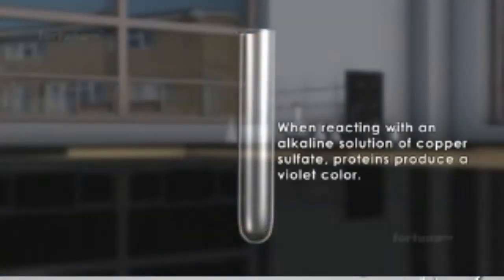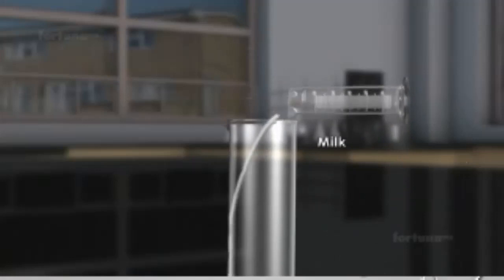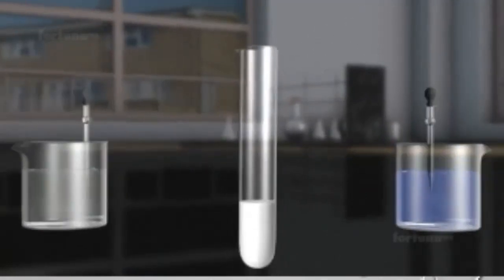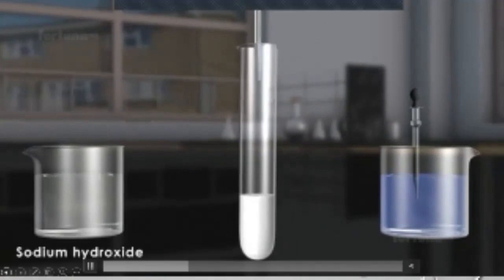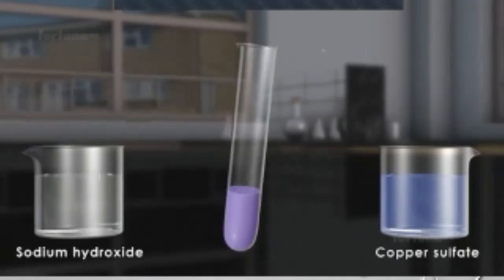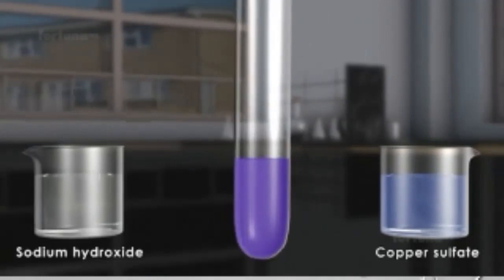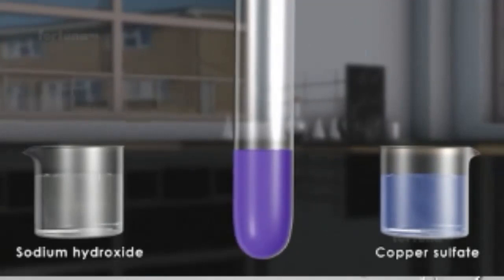When reacting with an alkaline solution of copper sulfate, proteins produce a violet color. Let's use this test to check for the presence of proteins in milk. Begin by pouring 4 milliliters of milk into a test tube. Next, add a few drops of dilute sodium hydroxide solution. Finally, add 3 drops of copper sulfate solution. Gently shake the test tube so that the 3 liquids are mixed well. As you begin shaking the test tube, you'll notice the solution turning violet, confirming the presence of protein in milk.